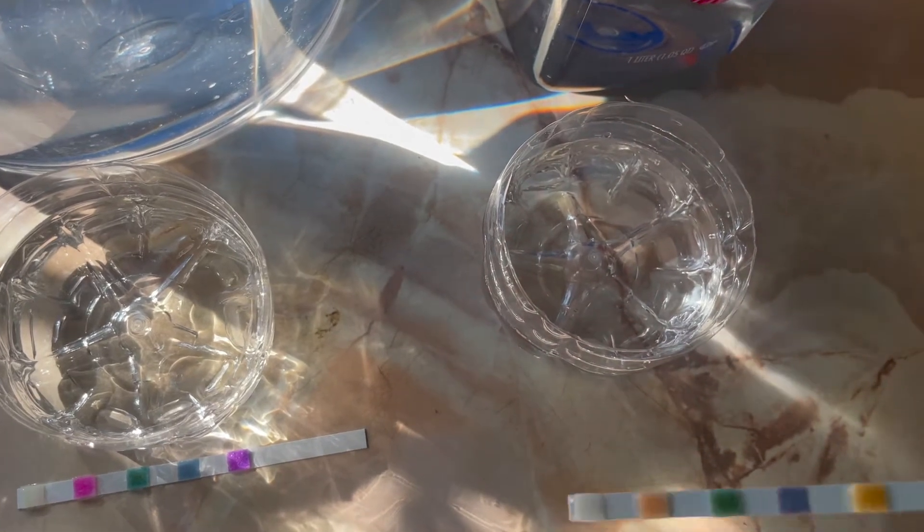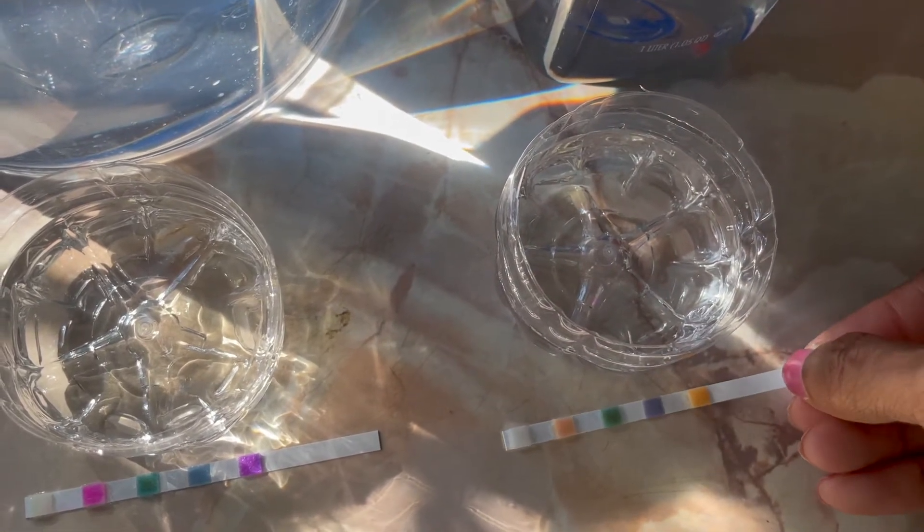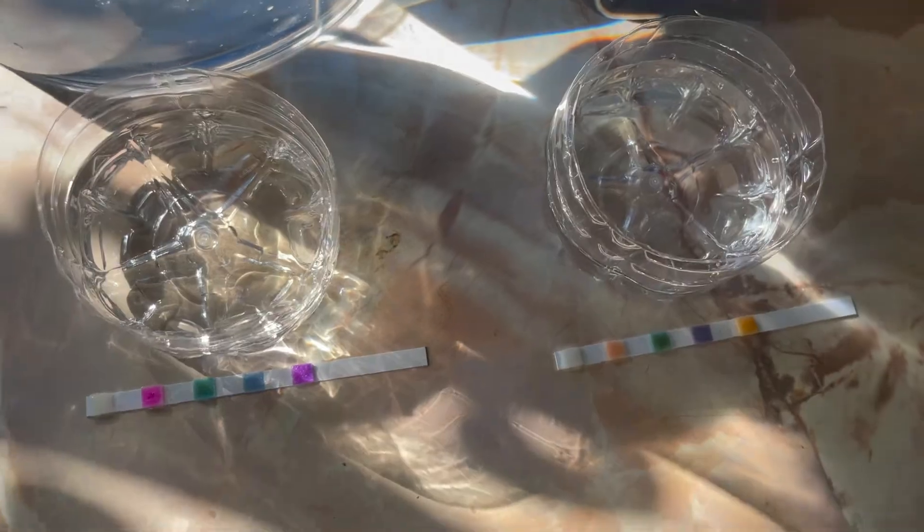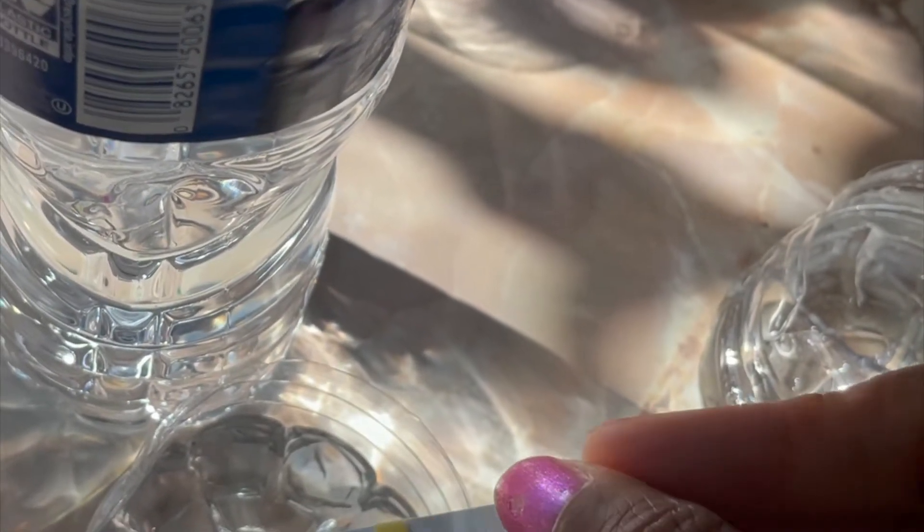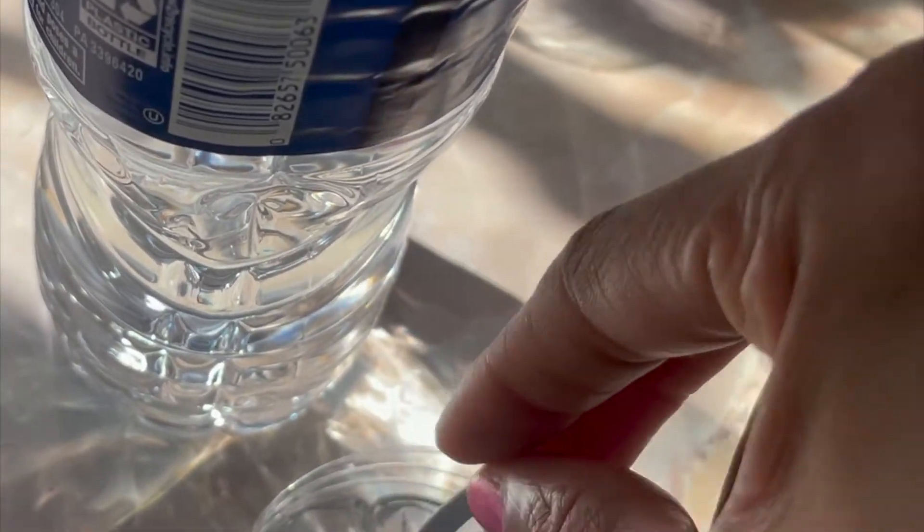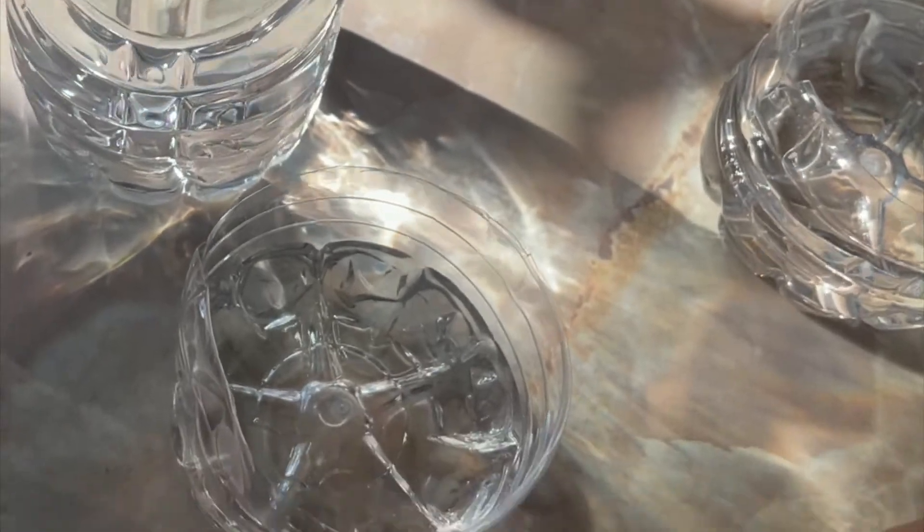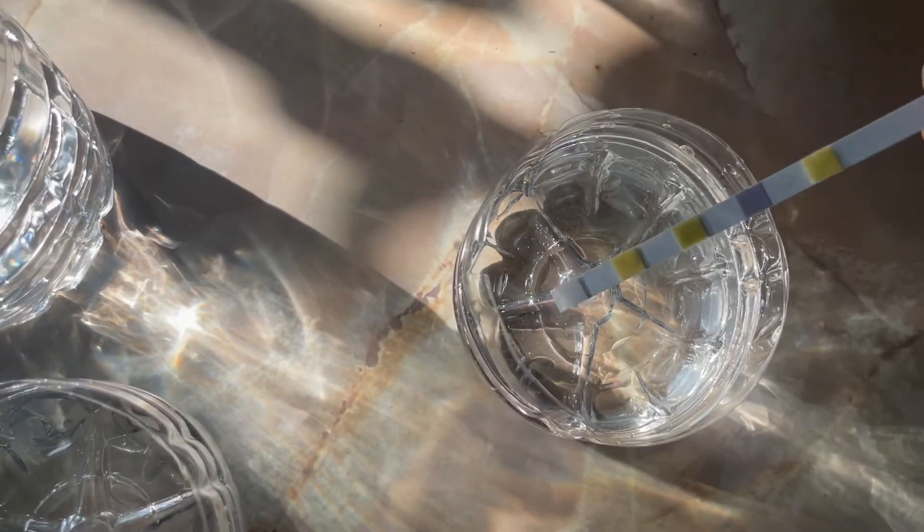Then I ran the same tests with Deer Park bottled water and then finally I tested the water from the tap water.